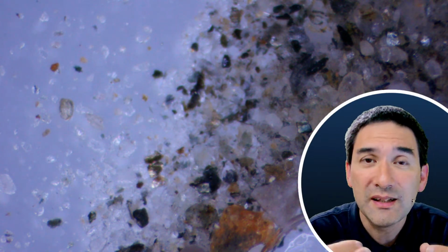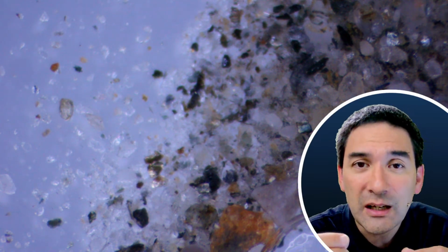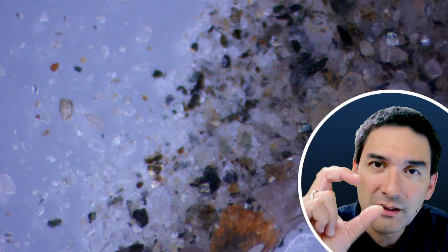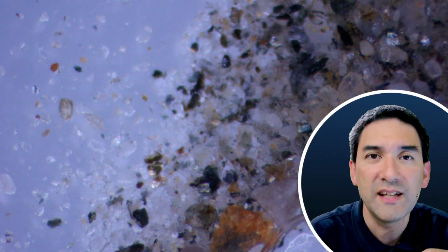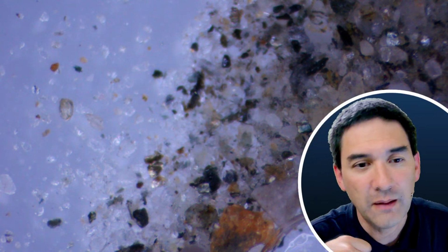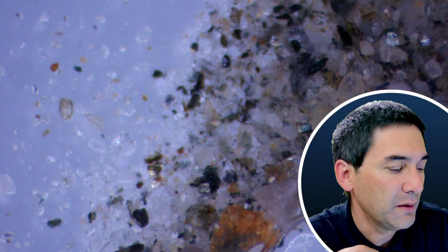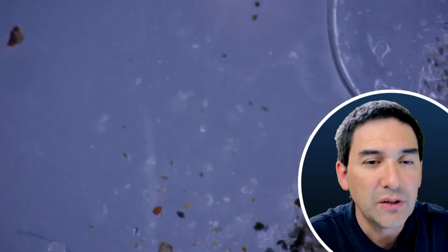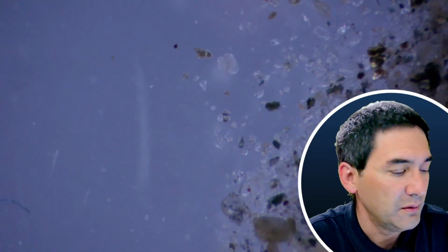The less dense material stays in the liquid. The sand grains will settle to the ground, and then I take the liquid on top and centrifuge it. This could also be used as a method to concentrate whatever is in there, possibly some plant material, some organisms, and so on. So that is essentially the idea that I'm going to be trying to work on.